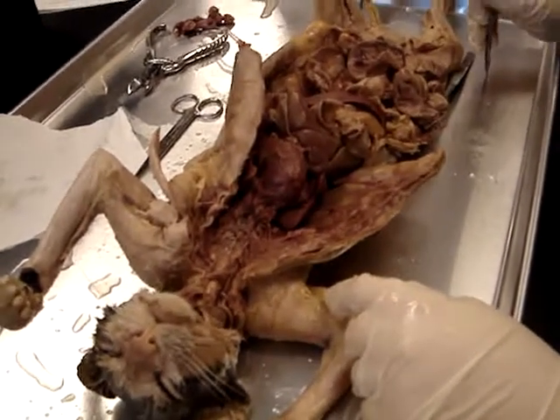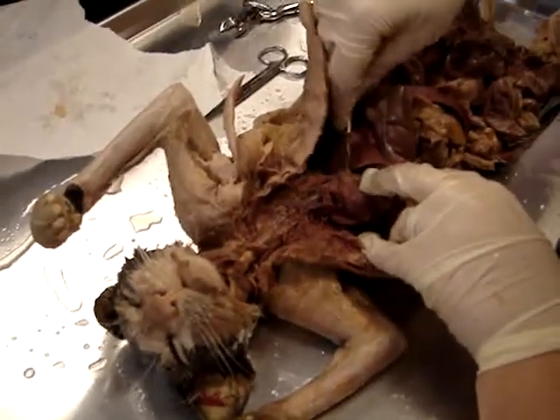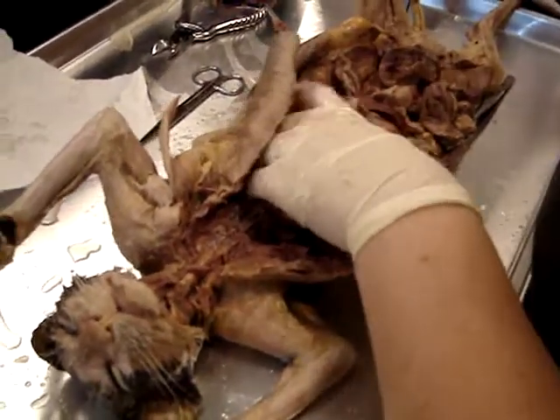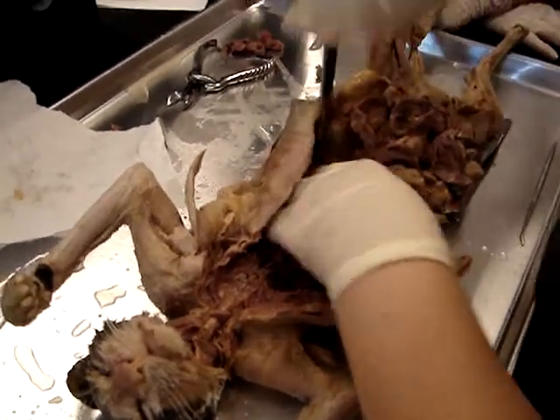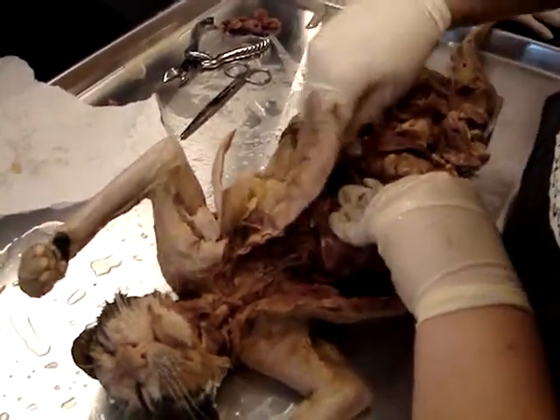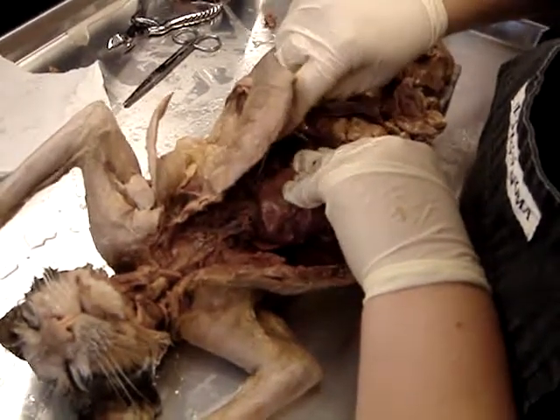Oh, yeah. Okay, all right. Then you can't really see the aortic arch very well. You can, it's just where the aorta kind of goes over the top of the heart. Okay, but that's the aortic arch. And then any part of the aorta that is found in the thorax, which is anywhere above the diaphragm, is called the thoracic aorta. So let's try to find our thoracic aorta.